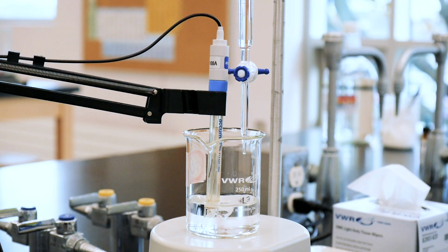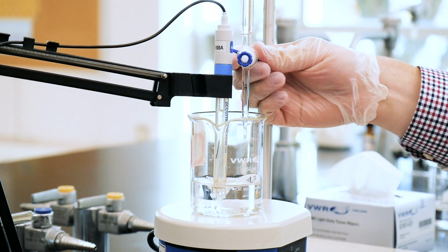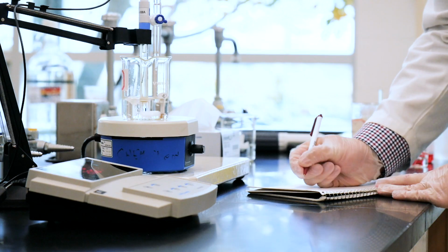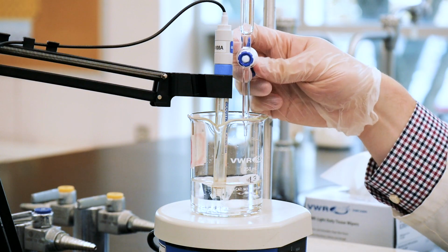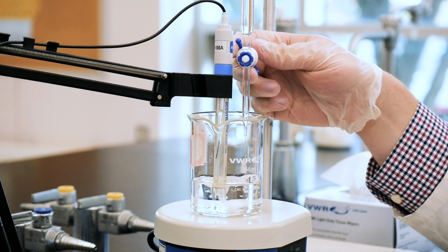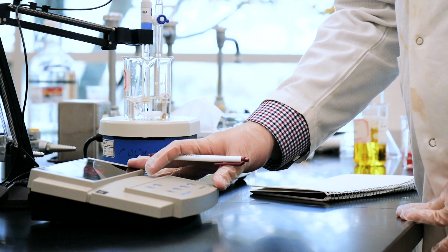Get your burette mounted in a good spot so you can make additions directly to your beaker and record the initial pH. Add about 1 ml of the NaOH solution. Record the precise volume and the resultant pH. Continue with these 1 ml additions of NaOH solution and keep a record of both the resultant volume according to the burette and the corresponding pH.